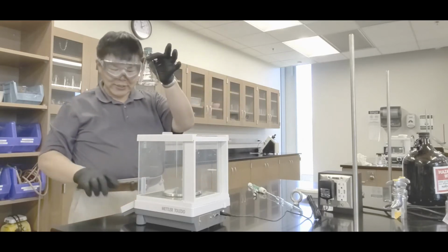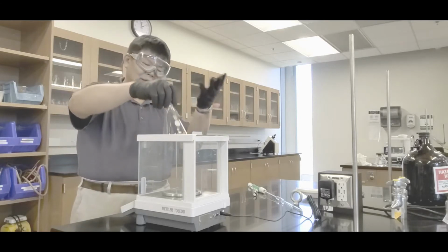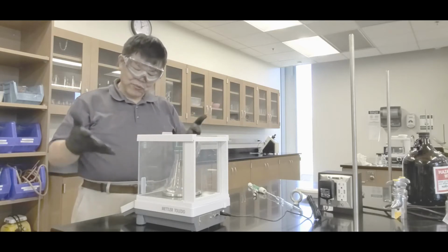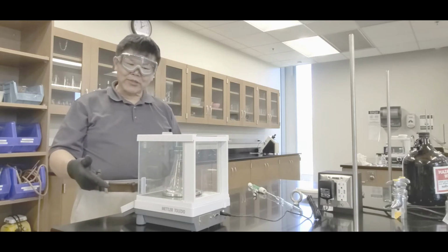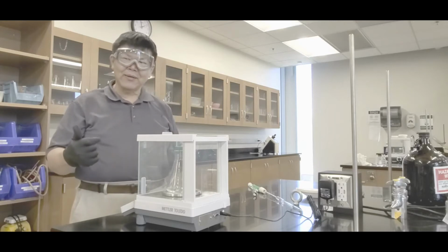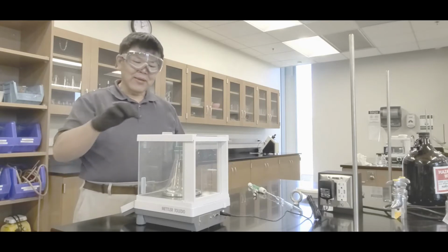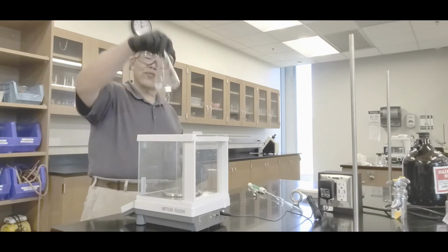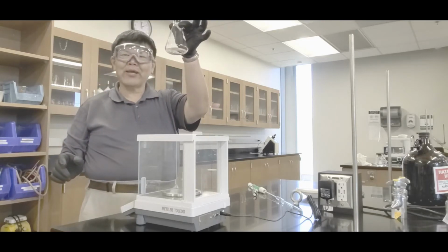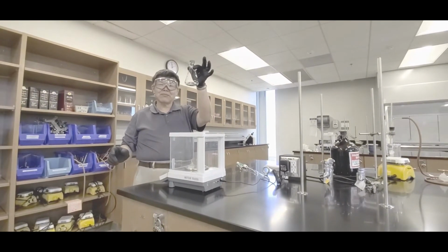Then come to the analytical balance again. Make sure you zero the balance. Open the door. Park that in there. Weigh it. And what happens is that the mass is stable, because none of the liquid is escaping, the stopper is stopping it, yeah? So therefore, record that. Now in that case, hey, you're done with the density part of this thing, yeah? All right, now reserve this portion for the index of refraction part of the experiment, okay? So therefore, leave that alone. All right, proceed to the next step.